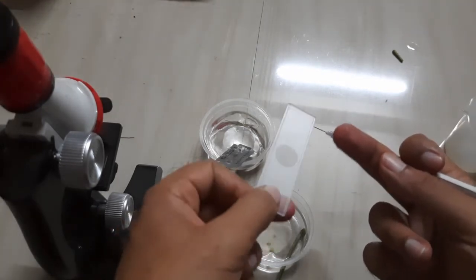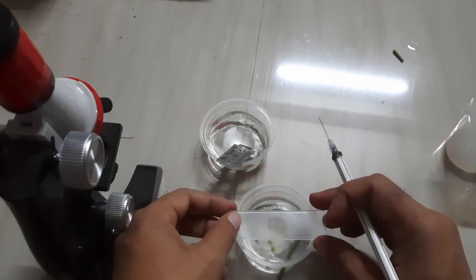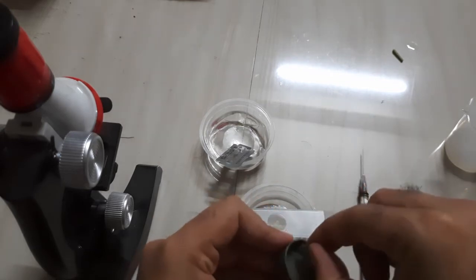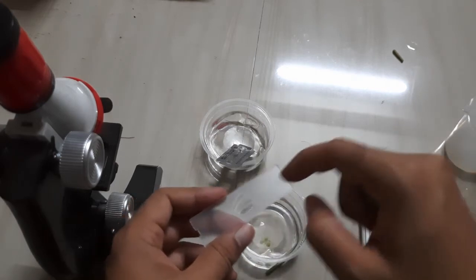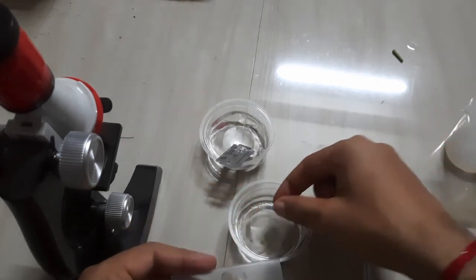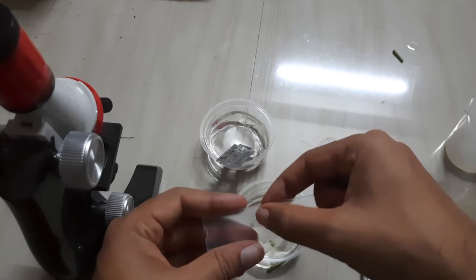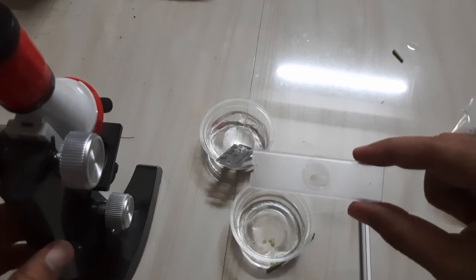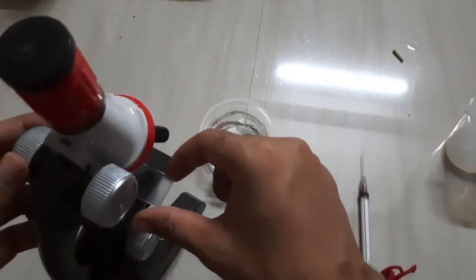Then you have to place it on a glass slide, place a cover slip over it, and then you have to see it under the microscope. You have to place it on the stage of the microscope and then observe.